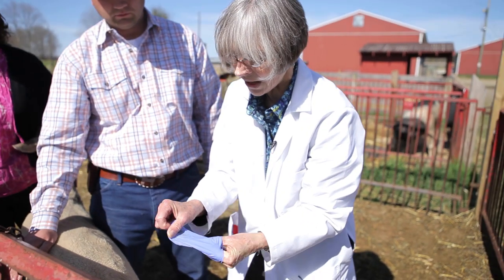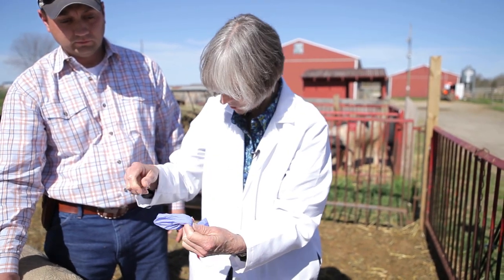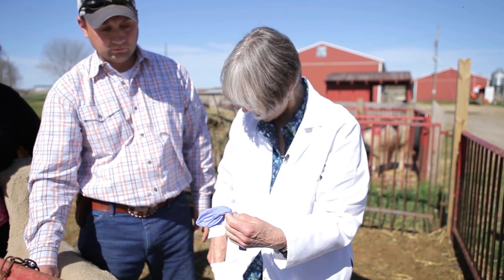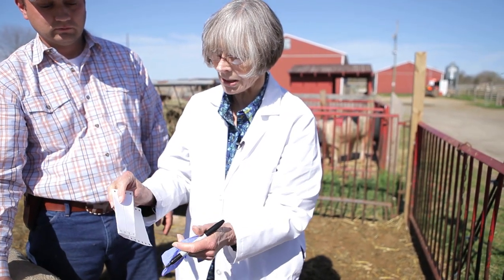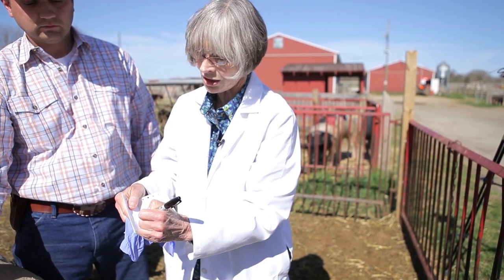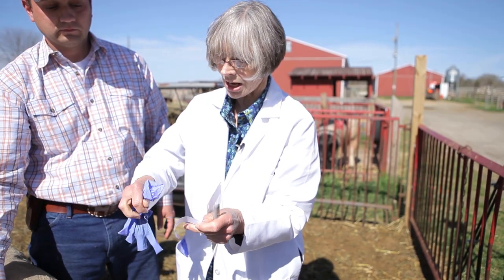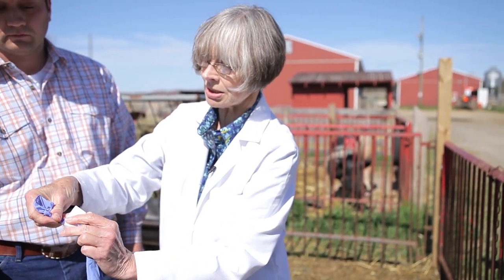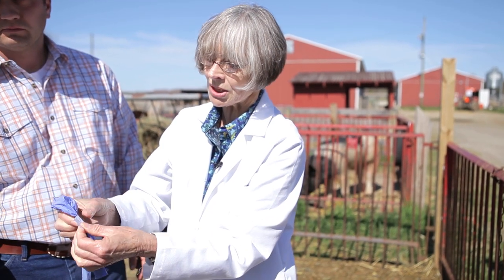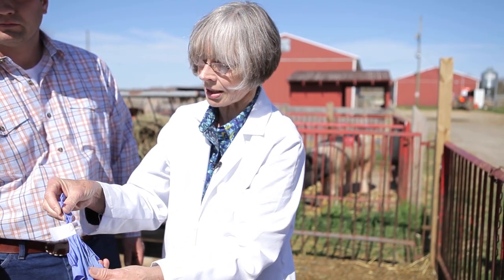Then pull the glove up over the fecal sample and you have a nice container for your sample. You can tie it off and label the glove with a sharpie or indelible ink pen. What I like to do is take a simple address label, write the animal's identification number on it, and use it as the closure for the glove. These labels won't stick to the material of the gloves — you have to stick them to themselves. Now you have a fecal sample identified and ready to be analyzed.